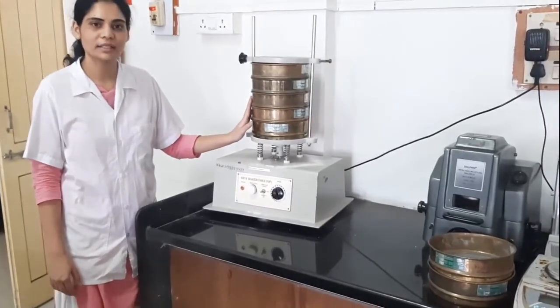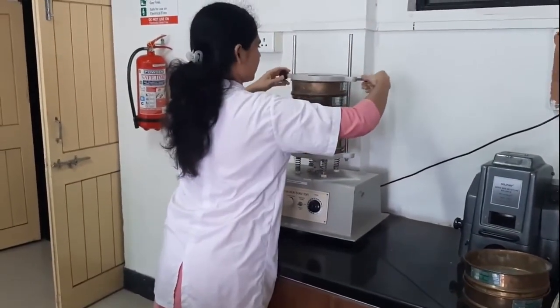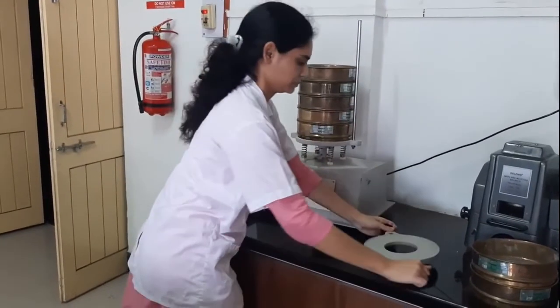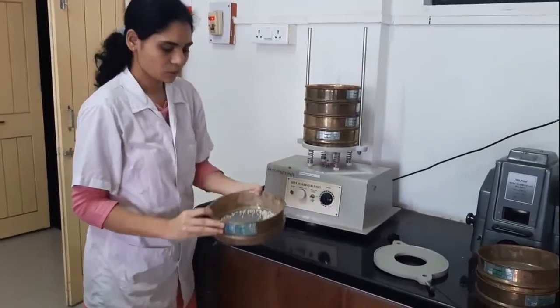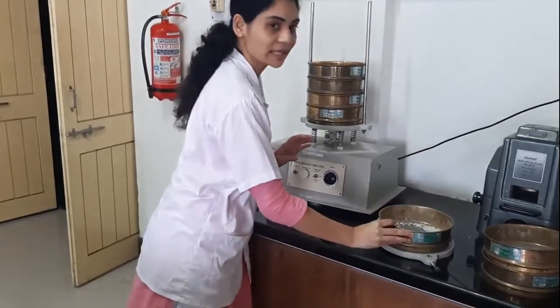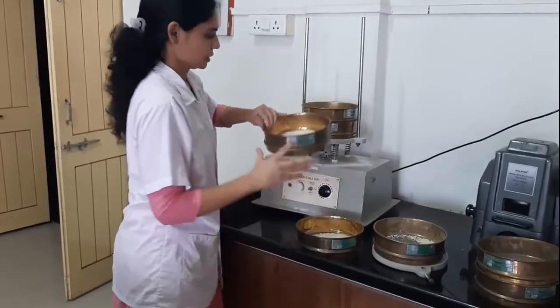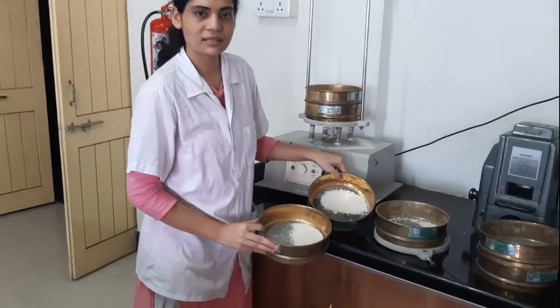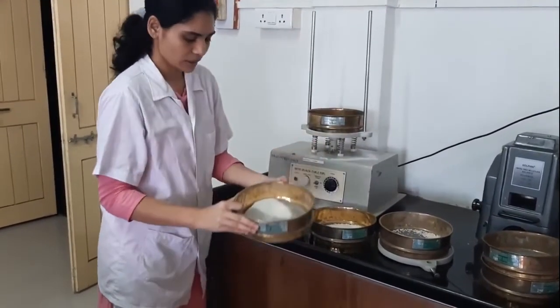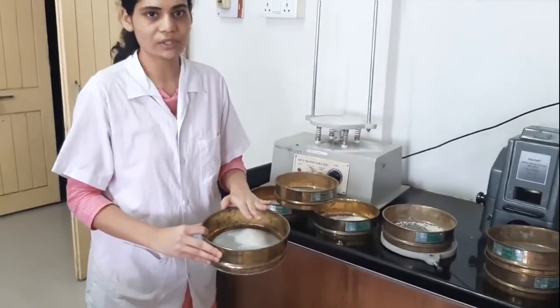Our 15 minutes are completed and we have stopped the equipment. Now we take out the sieves. You can see the coarsest material has been retained on the first sieve — we remove this material and weigh it, recording that weight. This is the next material retained on the second sieve. You can make out from the size difference that separation has completely occurred. This is the fine granule, and this is the finest granule. We take the weight of each amount.